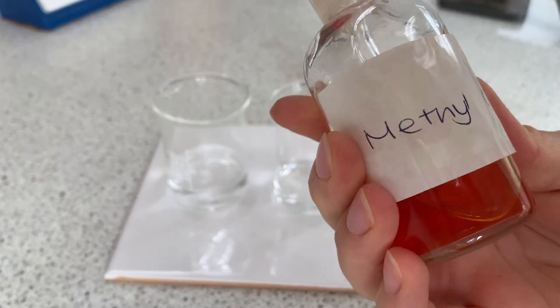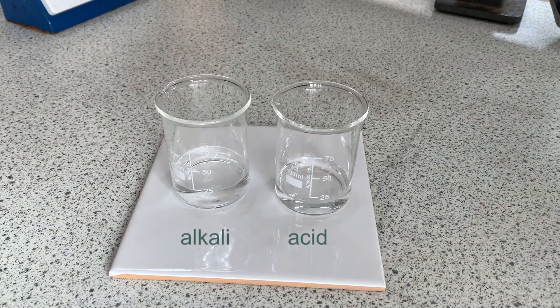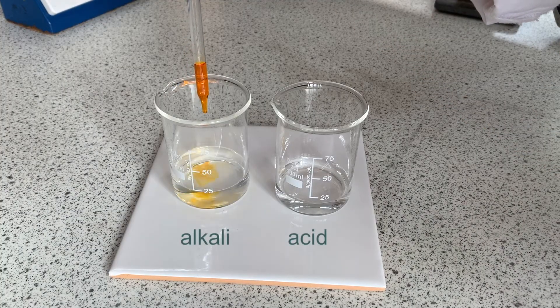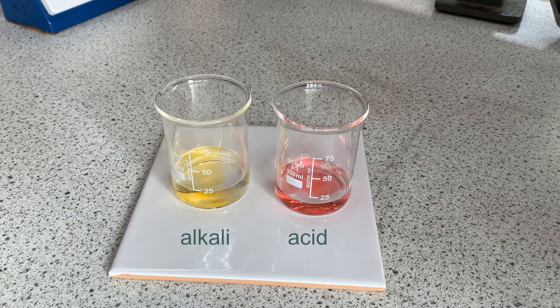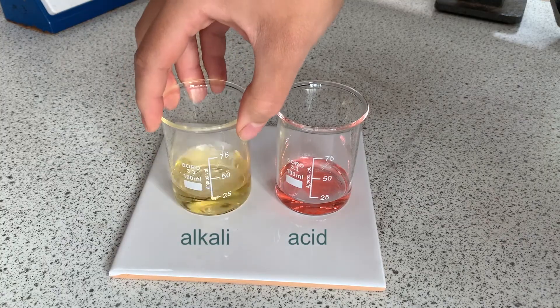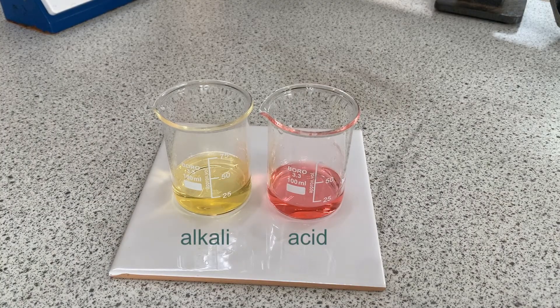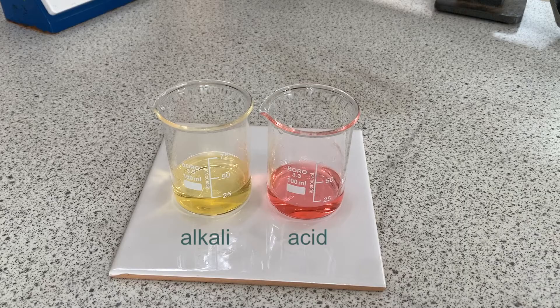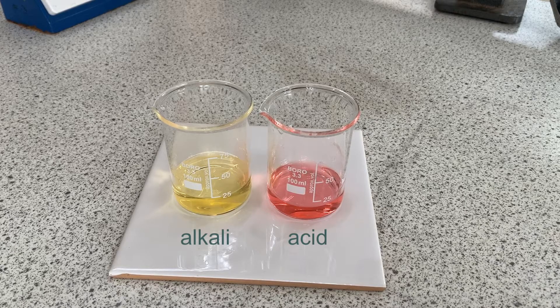Our indicator for this titration is going to be methyl orange. I've set up a beaker of alkali on the left and a beaker of acid on the right, and I'm adding a few drops of methyl orange to both so you can see the colour in each. Our sodium hydroxide solution will start as the colour on the left, and we need to stop after the exact drop that turns the solution from yellow to the colour on the right — the moment the solution turns from alkali to just becoming acid, meaning neutralisation has occurred.